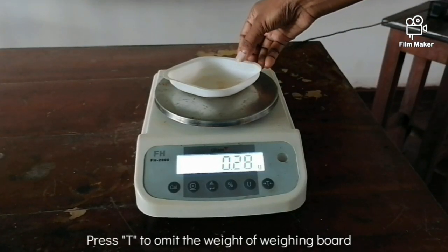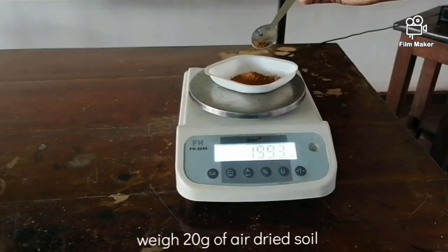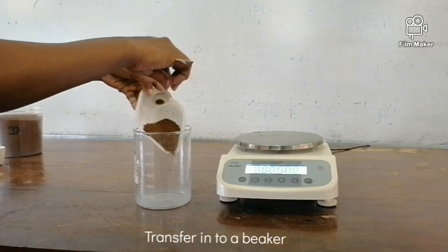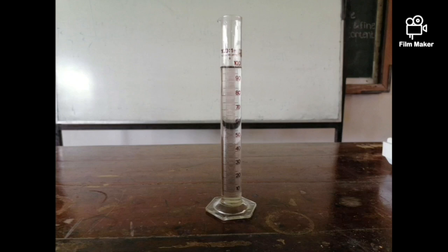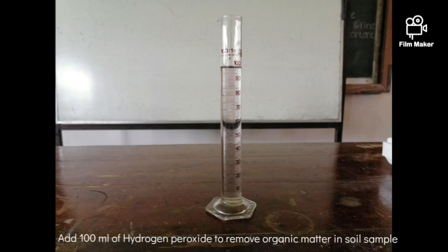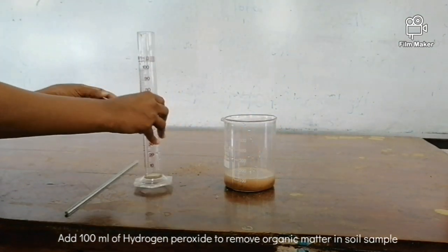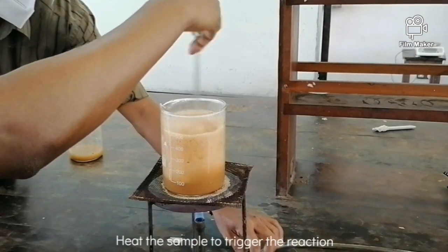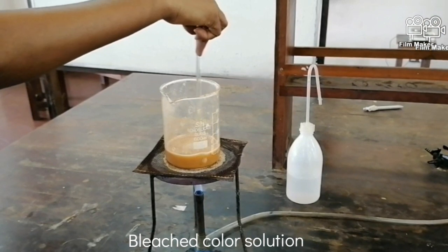Procedure: As the first step, weigh out 20 grams of soil and transfer it into a beaker. Then add 100 ml of 3% H2O2 and heat while stirring until the soil gets a bleached color. We heat the mixture to increase the reaction rate.